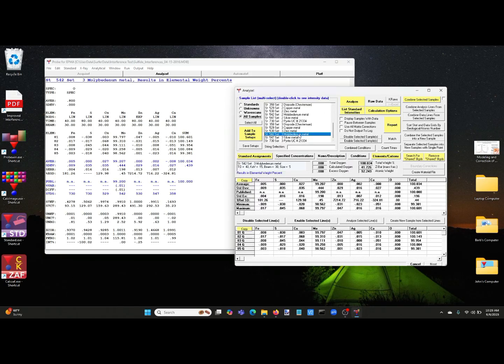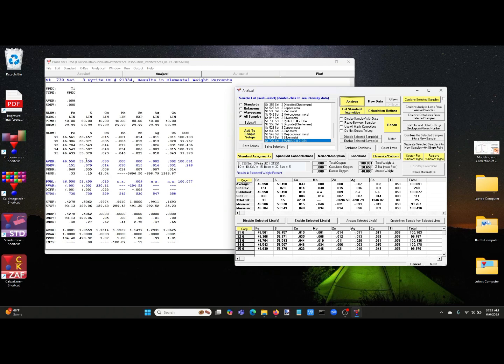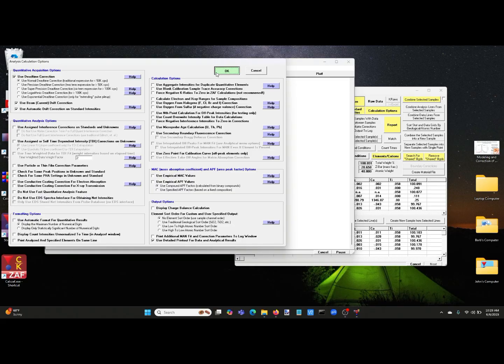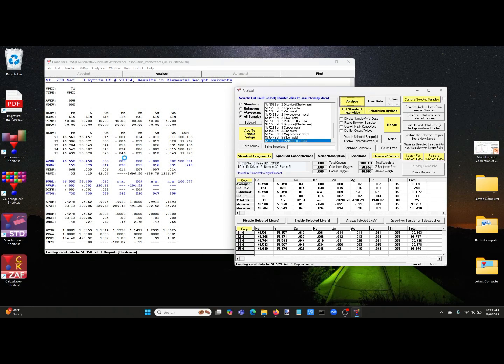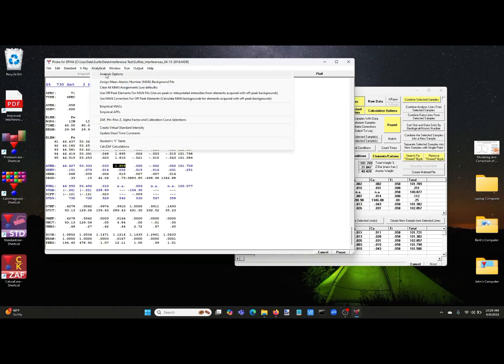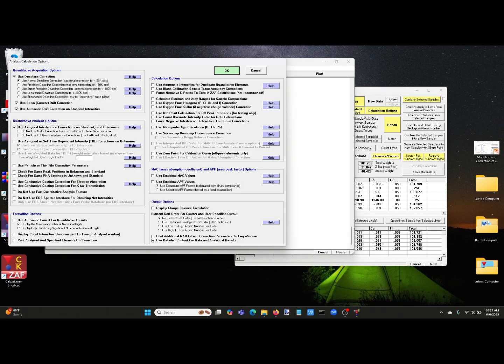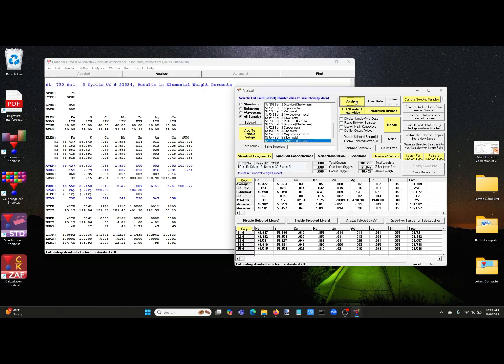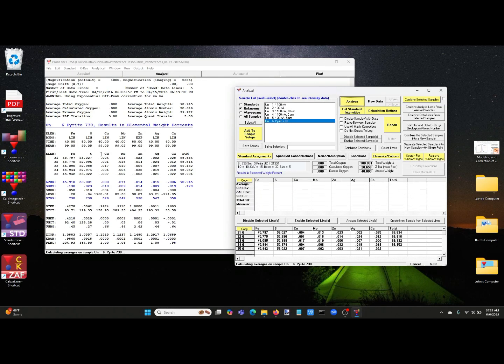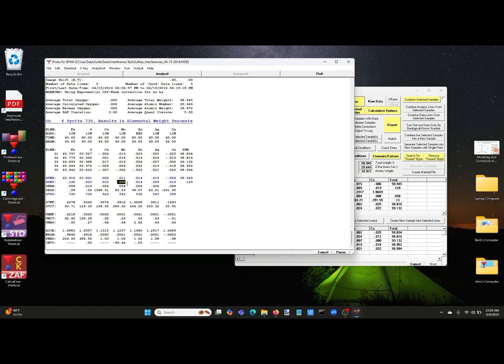And we also can check by looking at our pyrite material, and we can see that there is no interference of sulfur on molybdenum. In fact, if we turn off the interference correction here, we can see what that would have been. So here's, again, the same analysis with the interference corrections turned off, and you see we're getting almost 2 weight percent of anomalous molybdenum when there shouldn't be any. But we can turn that back on and analyze it again. And back to 0. We can also apply this to unknowns, of course. And as you can see, we're essentially 0 molybdenum within 2 standard deviations of 0.